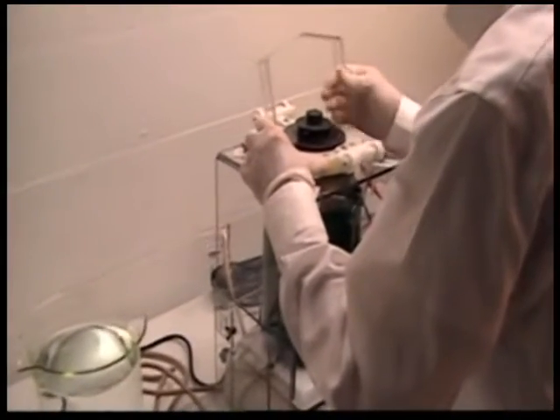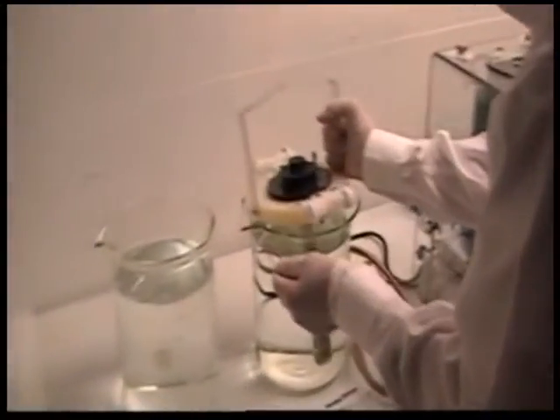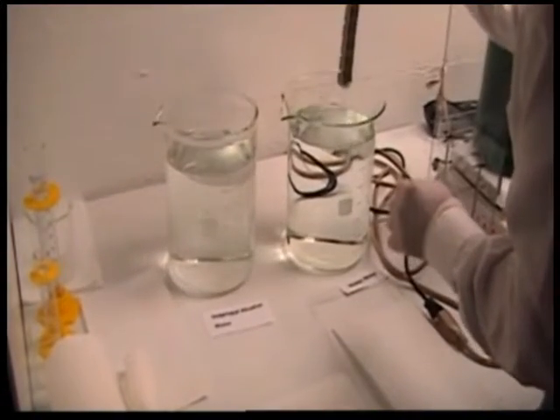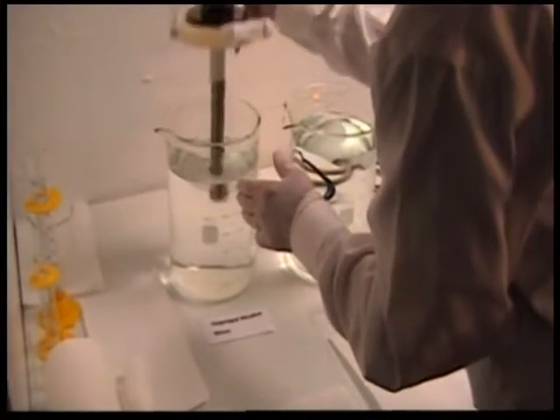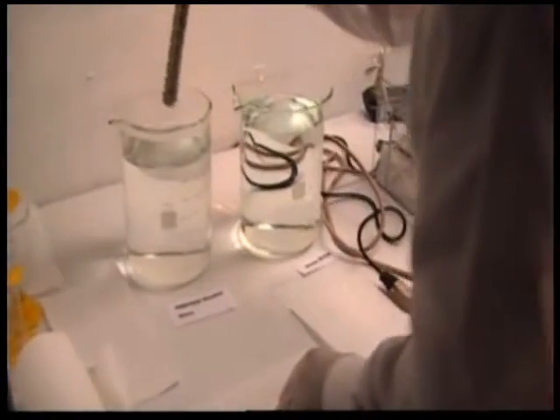I'm going to remove the spiral contractometer with the plated helix at this point and go through a water rinse. There are drain holes designed in the center piece that allow free rinsing of the helix. Then I'll go into the isopropyl alcohol, giving it a thorough rinse.